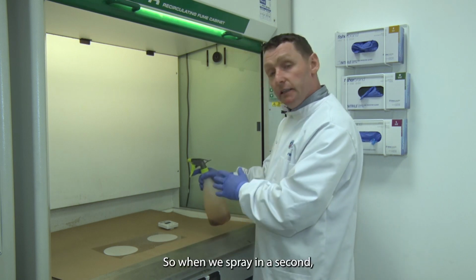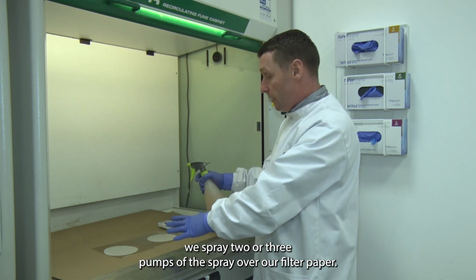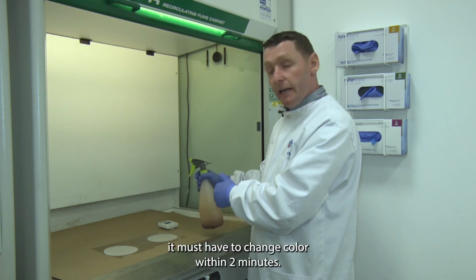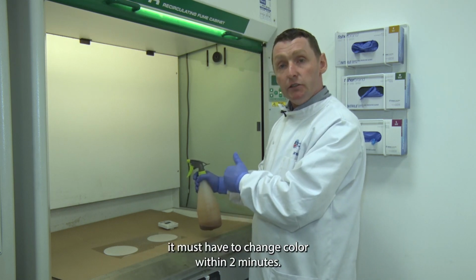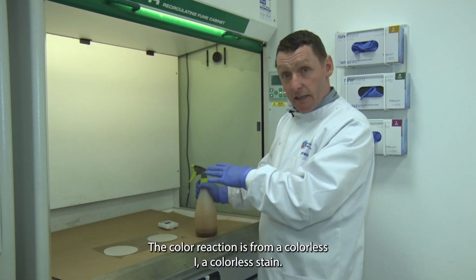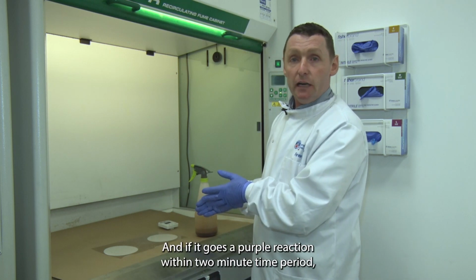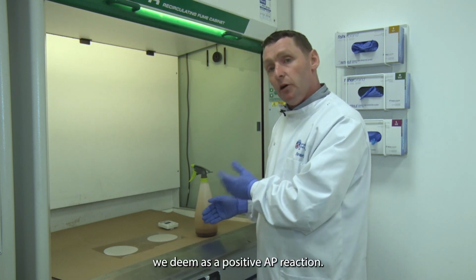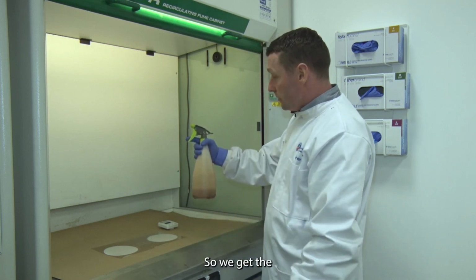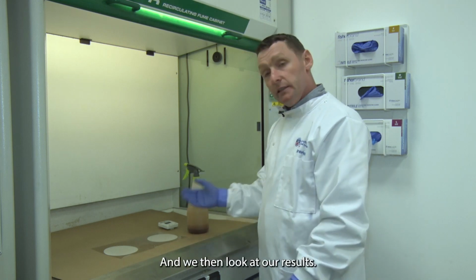So we spray 2 or 3 pumps of the spray over our filter paper, and if we've got a positive control and a positive result, it must change colour within 2 minutes. The colour reaction is from a colourless stain, and if it goes purple within the 2-minute time period, we deem that a positive AP reaction.